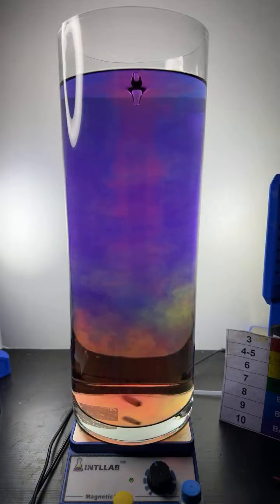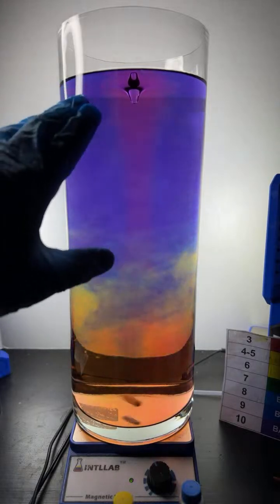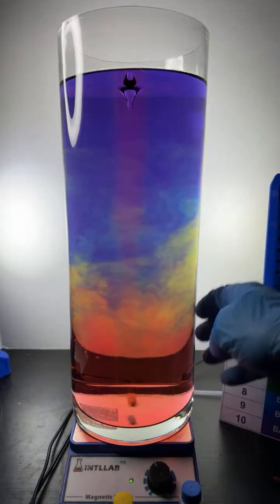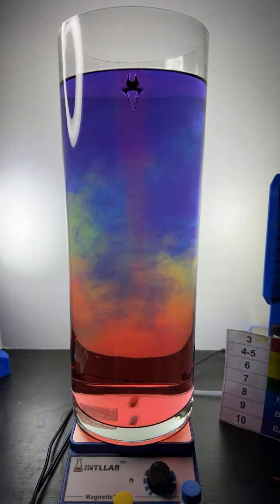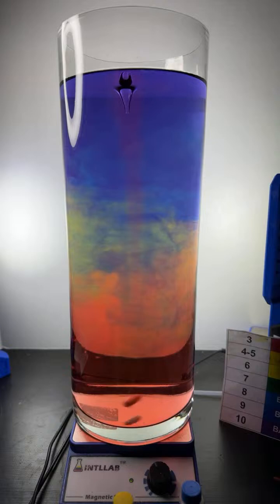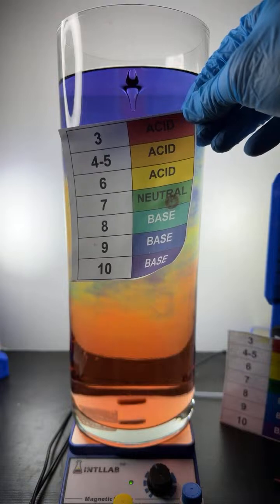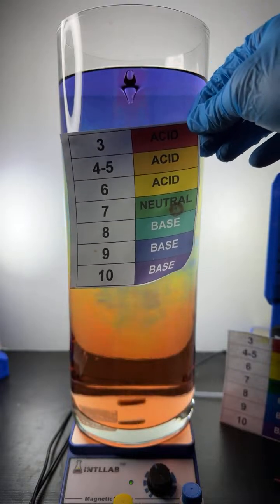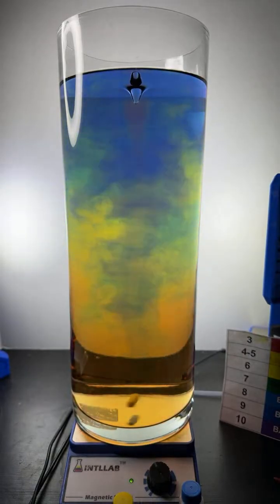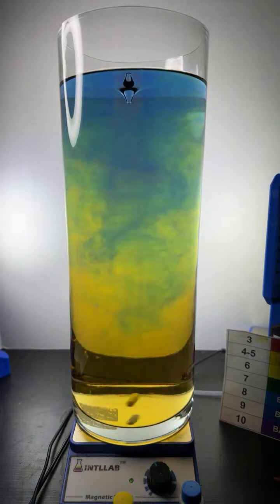If you're new to the live, what we do here is we just hang out. We watch the beauty of this experiment, which is I've just placed some universal indicator into a very large flask. This flask is like 1.5 gallons of volume. And universal indicator changes color depending upon pH, which is how acidic or basic something is. It follows the colors of the rainbow, with pH 3 being the most acidic. And thanks, Sarah Shrey. And pH 10 being the most basic, where 7 is going to be neutral. And there are times when there are regions of all different pH values in the flask.